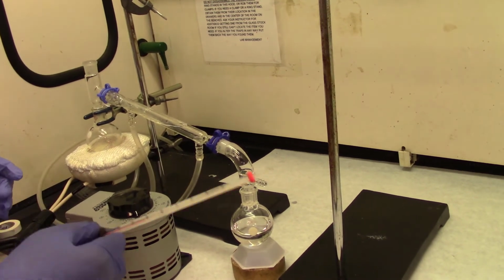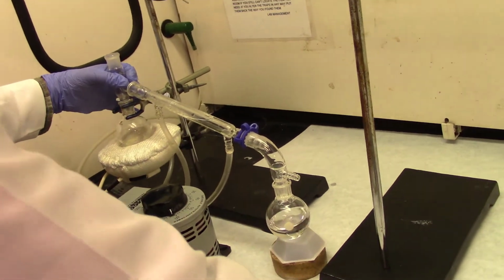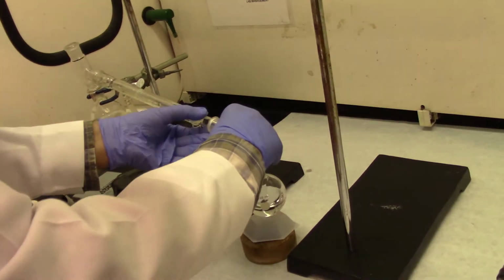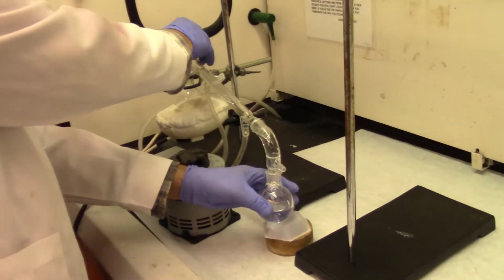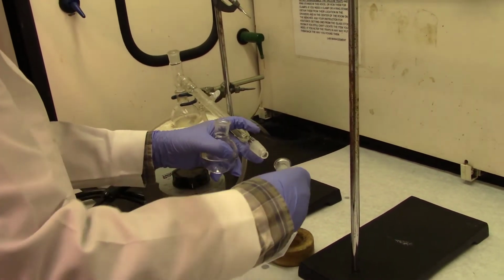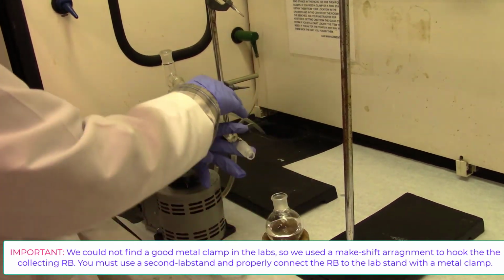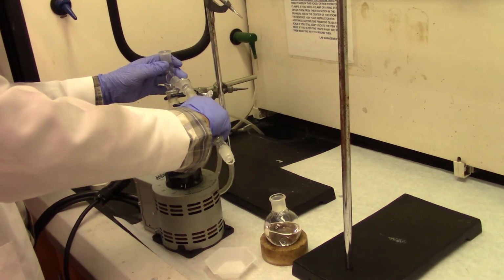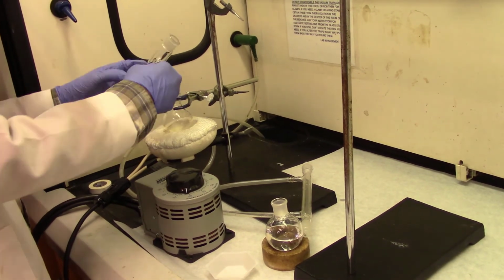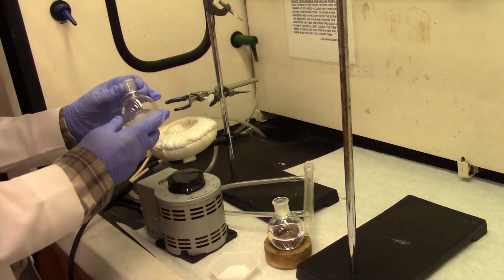You remove the thermometer adapter and the thermometer, and you remove the 3-way connector. Always disassemble from top to bottom. Okay, you remove the Keck clamp, remove the distillation head, and remove the round bottom flask. You should actually be using a second clamp to fix the round bottom. It's a good idea to do that. We couldn't find a good clamp, so we had to use some makeshift arrangement. You remove the 3-way connector, and finally you remove this.